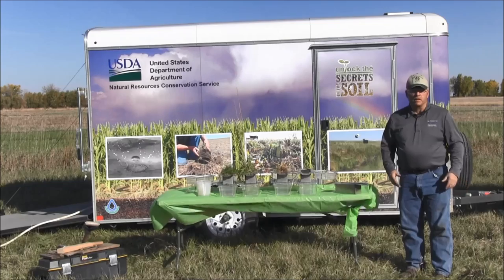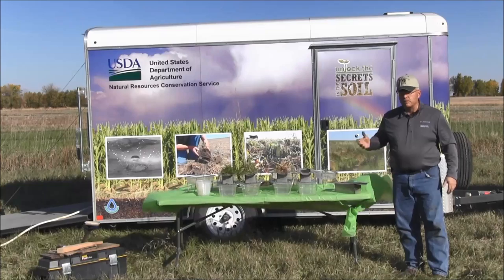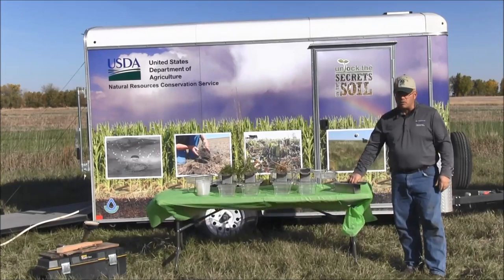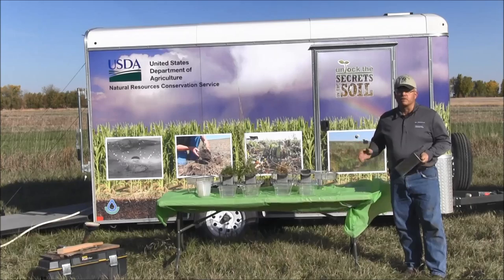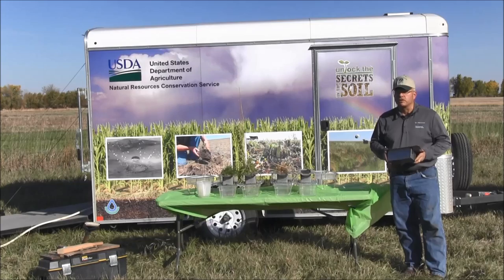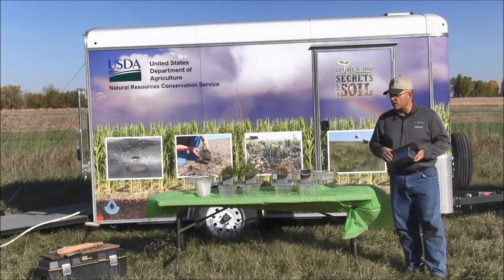My name is Jeff Hemingway. I'm the NRCS soil health specialist here in South Dakota, and today we're going to talk a little bit more about our tabletop rainfall simulator. We've got it set up here, but what I really like to do today is talk a little bit more about actually collecting a sample properly for the simulator. At some point it makes a huge difference on what we have and what we're really looking at to get that sample and have it react like we think it should. So let's go grab a sample.